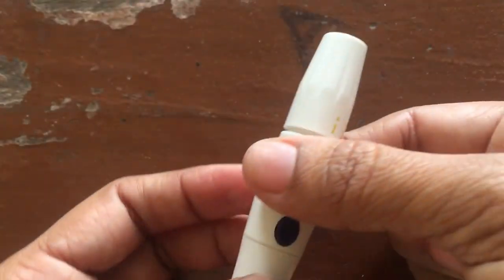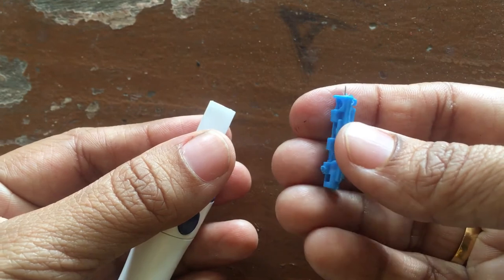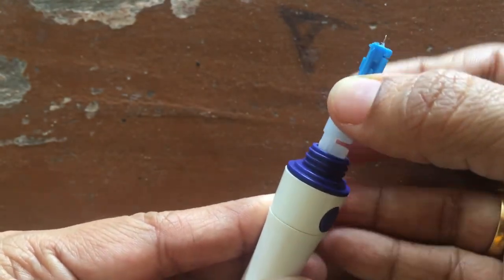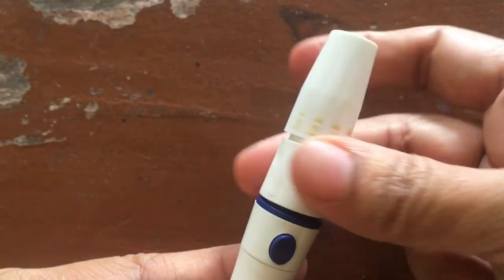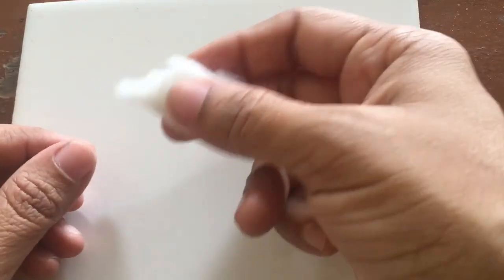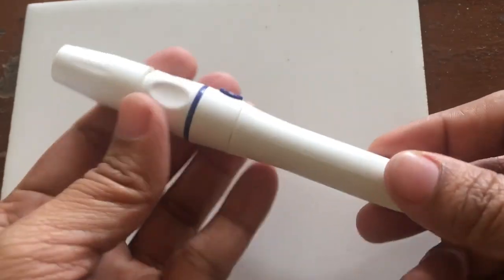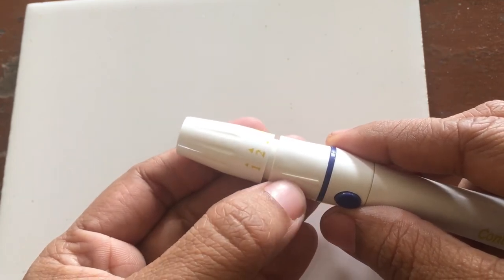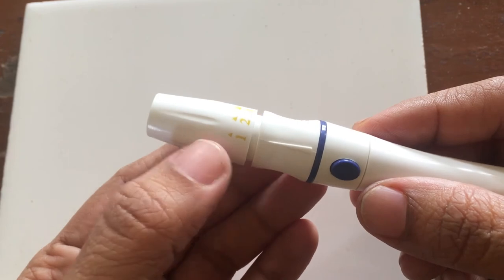Now we can start the practical. First we need to prepare the lancet for pricking — turn its cap upward and insert the needle. After fixing it, press it, then replace the cap over the needle. Next, sterilize your finger with alcohol — you can choose either your middle finger or your ring finger. Before pricking, load the lancet by pulling its back. You can see some markings; adjust the marking according to the required depth of the prick.